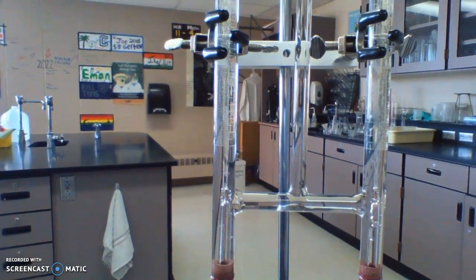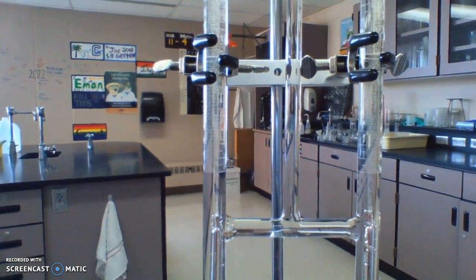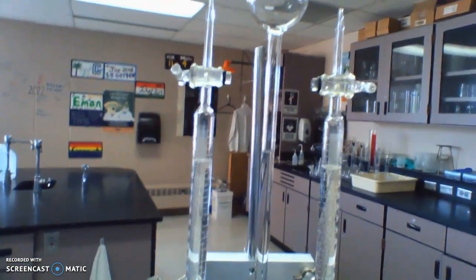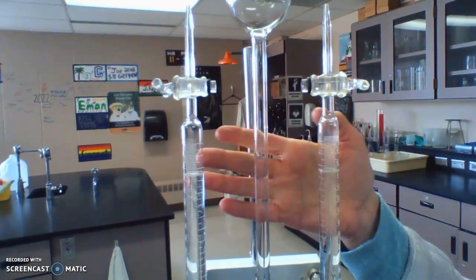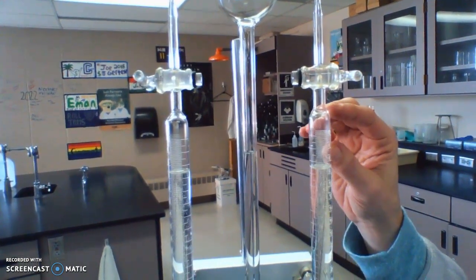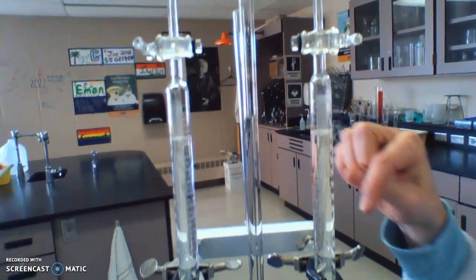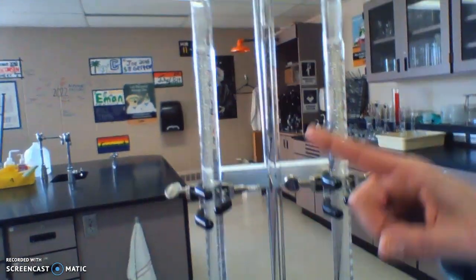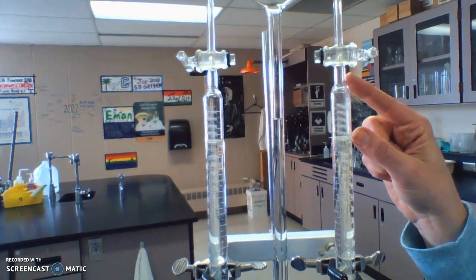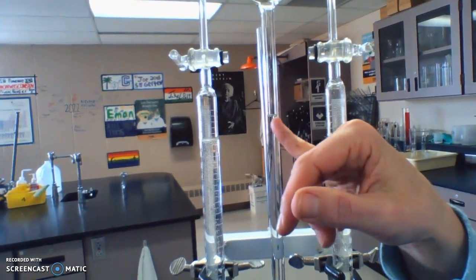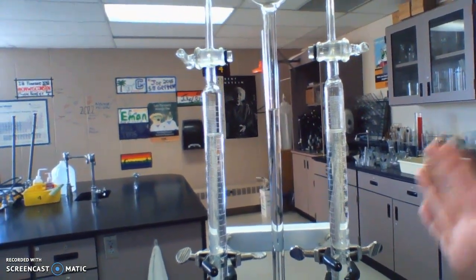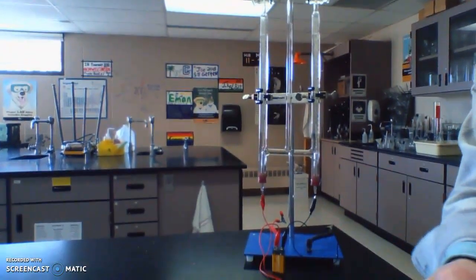We're going to see bubbles being formed. You can see the bubbles are coming off of the electrodes and they're filling the top of the tube where that air was. They can't escape, so as they fill in here they're going to push the water down, which is connected to here and is going to push this water up. As this continues we'll collect the gas in here.